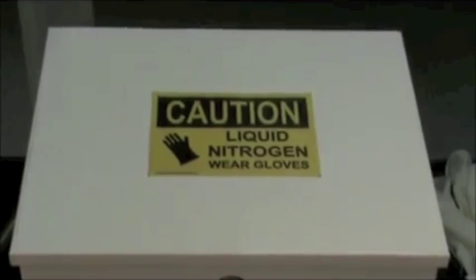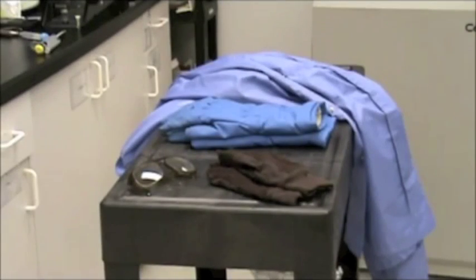As working with liquid nitrogen may be very dangerous, be sure to wear protective safety glasses, lab coat, and gloves. Prepare the work area to prevent accidental spills.